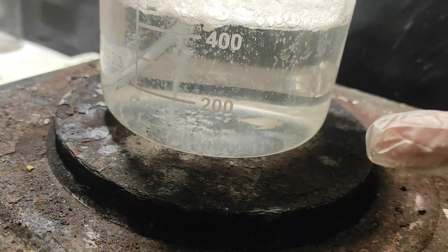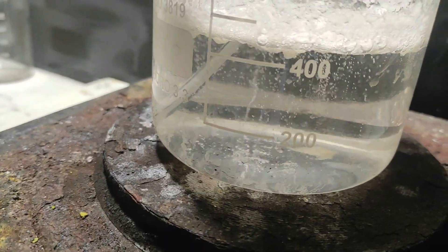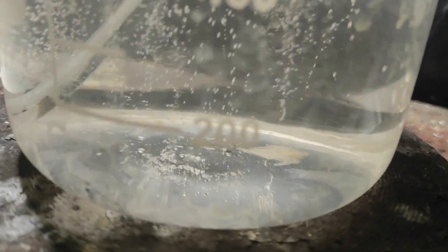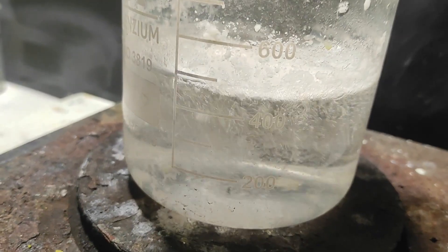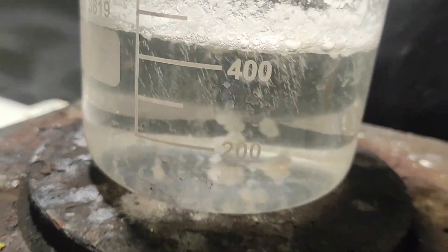We heated the solution because sodium carbonate is slow to dissolve and to react in cold water. As more and more carbonate is added, you can see that the solid benzoic acid disappears slowly. And when it's all gone, we know we have added enough sodium carbonate.